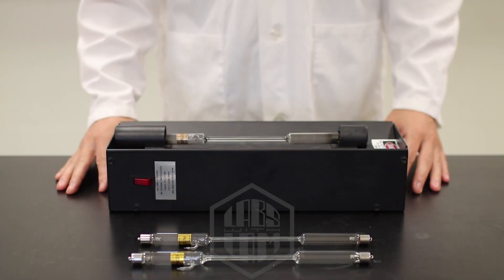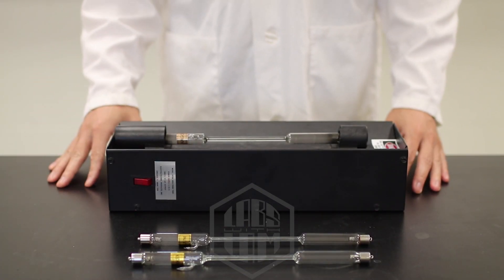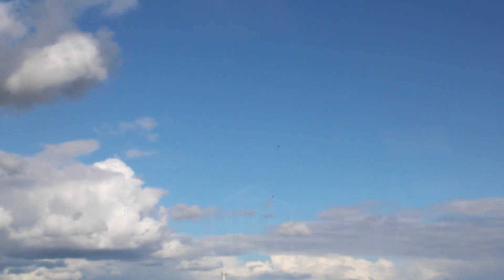Yeah, that's pretty neat, eh? Okay, one more thing just for fun. Let's just swivel around and see what the outside looks like. Now what you're seeing is the line spectrum for sunlight.